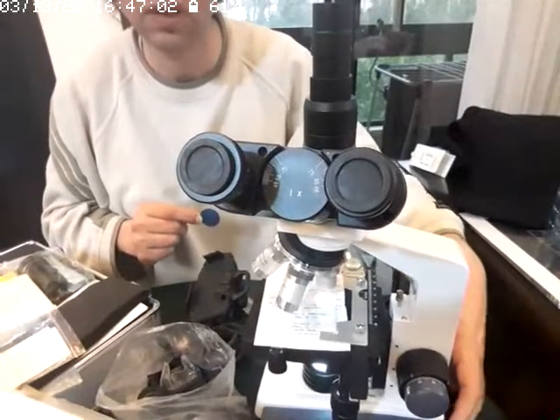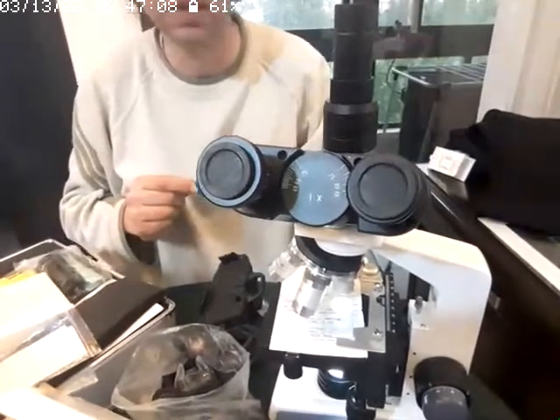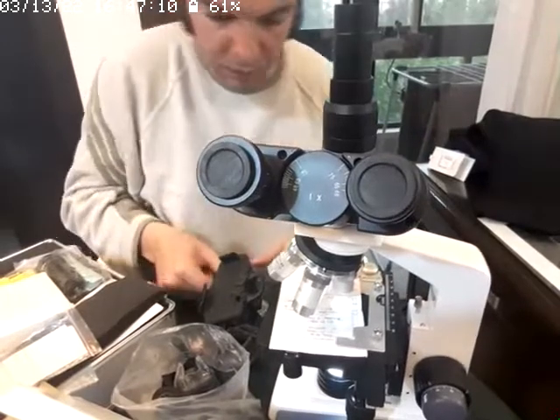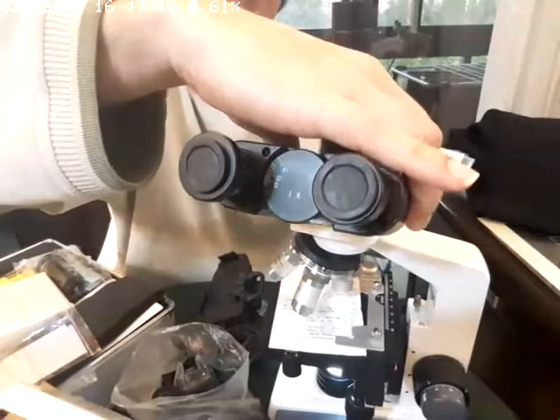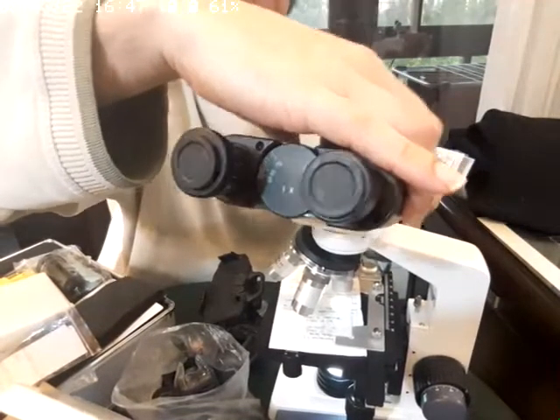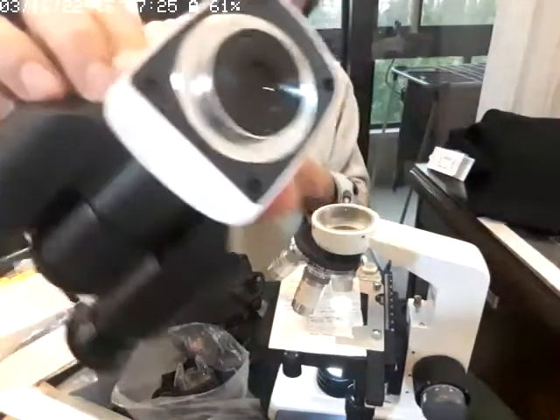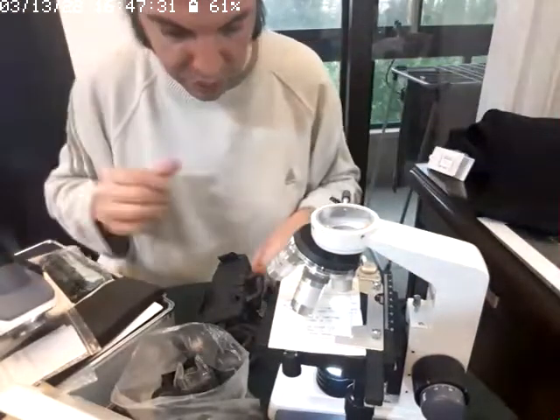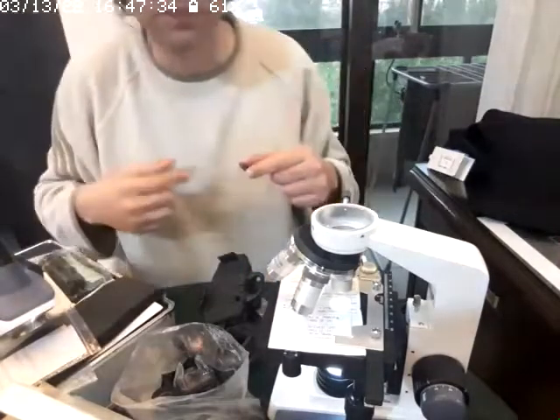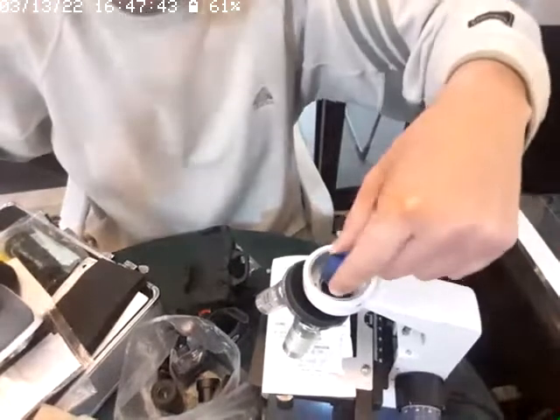Here, on this side there is a screw. I'll have to remove it in order to remove this head. So I remove the head first. I know it's annoying because you might hurt the glass inside. See, there's the glass. This is all optics, you might hurt it. There's also optics over here, so let's place the camera on top of the microscope. You just install it like this.